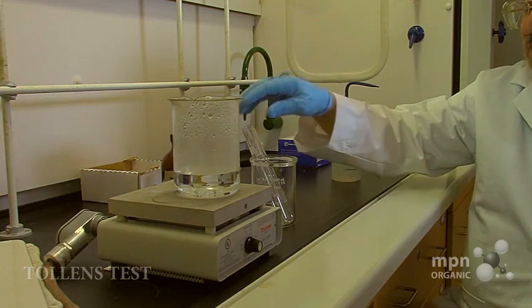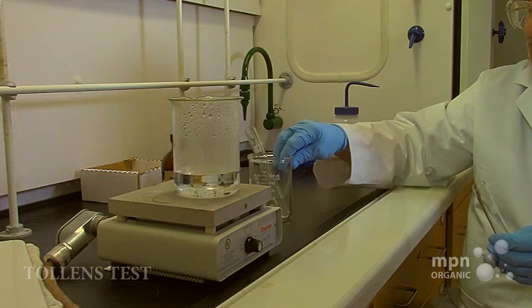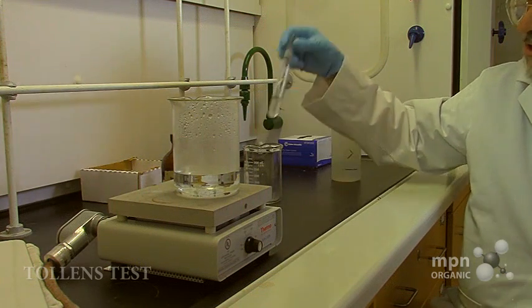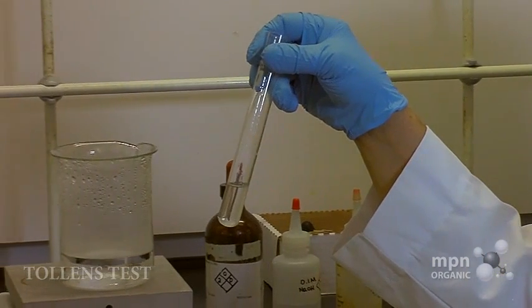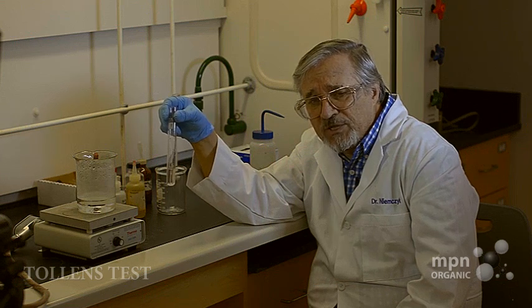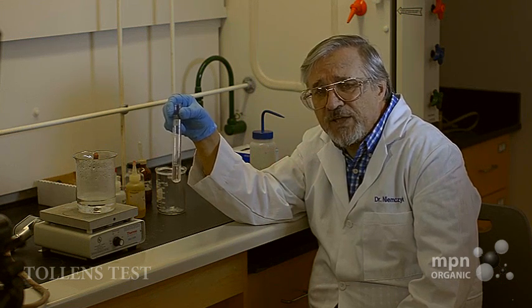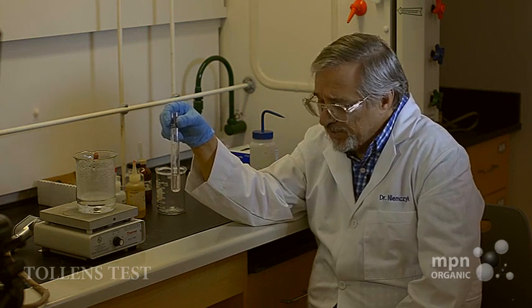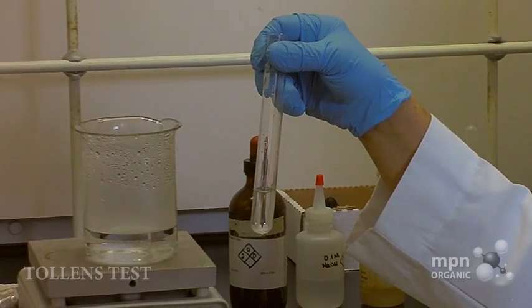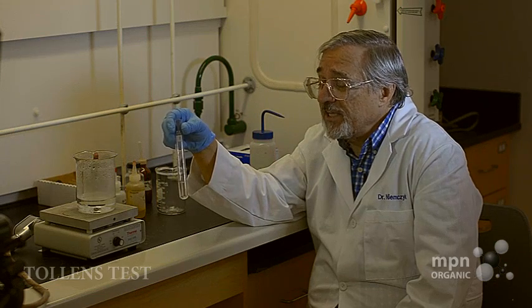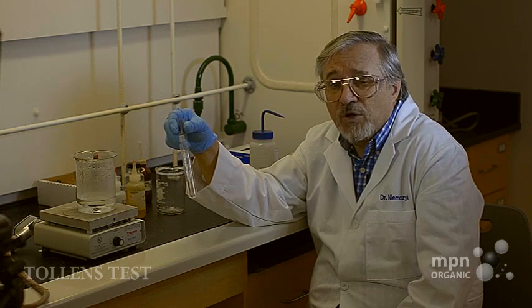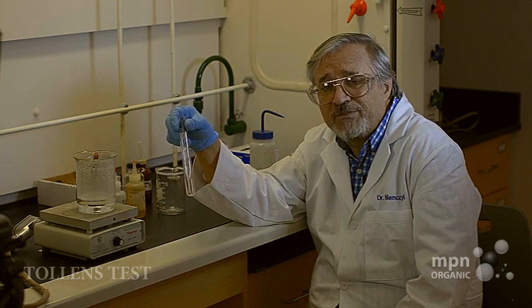And I'm going to demonstrate that today. Here we have a solution of glucose in water. Glucose is a solid material which has two advantages in this test. First is that it is a very water-soluble material. And the second thing is that when glucose dissolves in water, it actually provides us with a small amount of aldehyde.